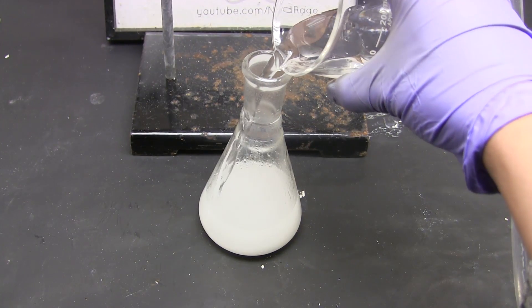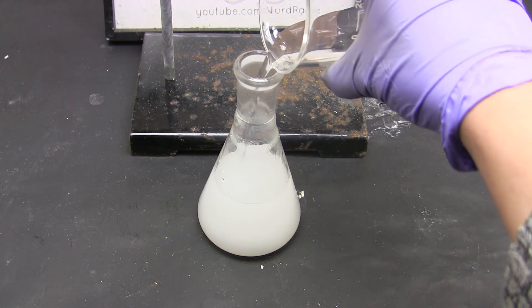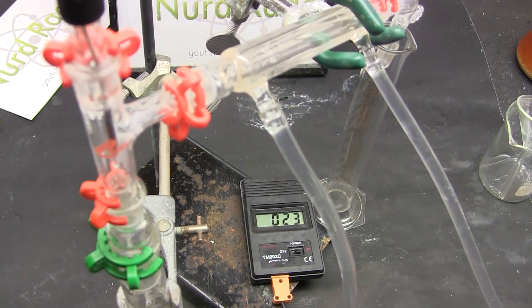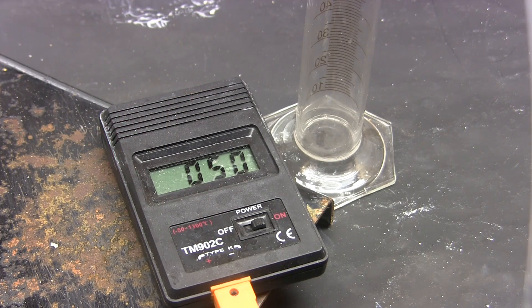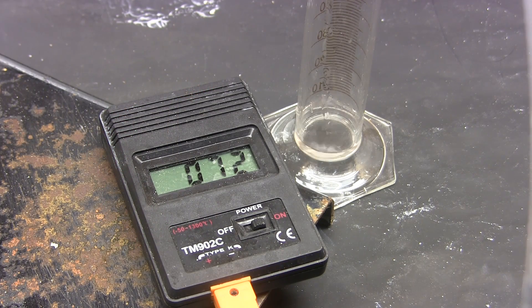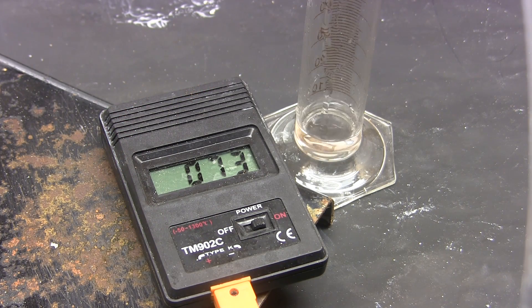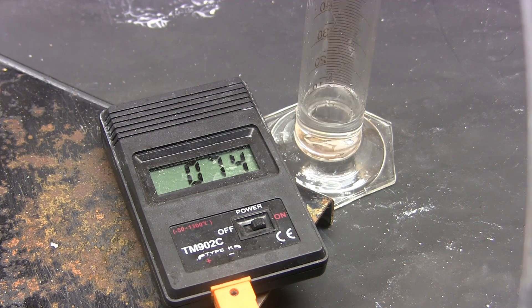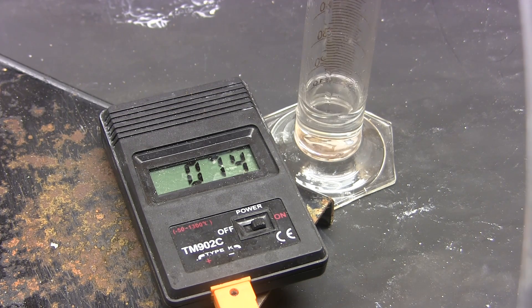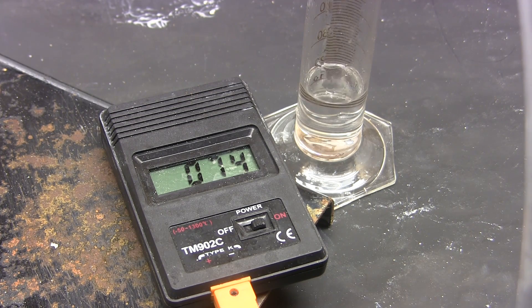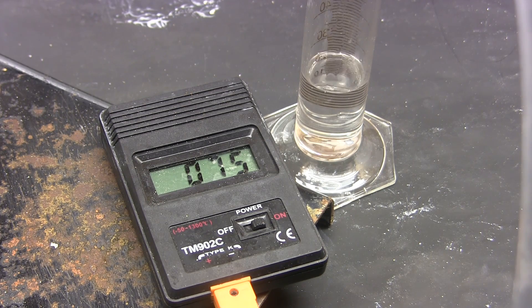Now if you don't want to lose your propionic and/or sulfuric acids, you can fractionally distill off the ethylpropionate. It forms a low boiling azeotrope with ethanol. So just collect the fraction that boils below 78 degrees Celsius. I don't have an exact number as I couldn't find one in the literature and my thermometer isn't accurate or precise enough to trust directly.